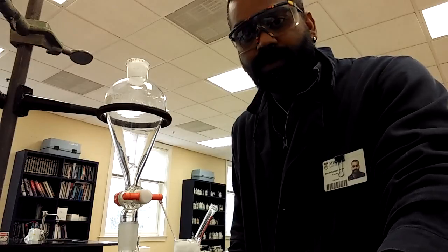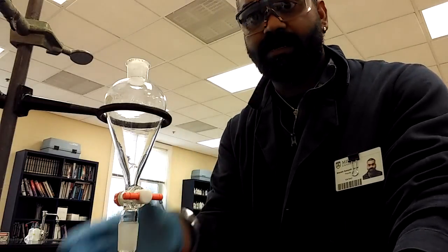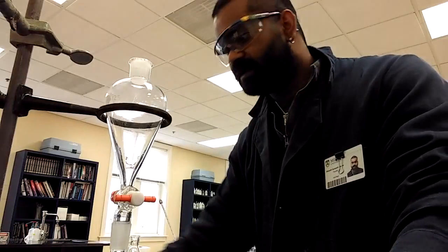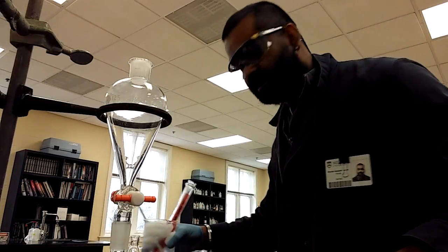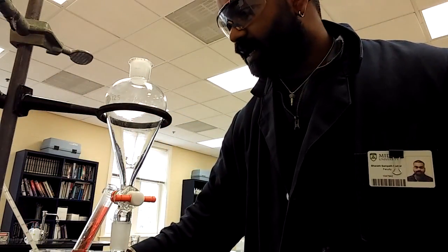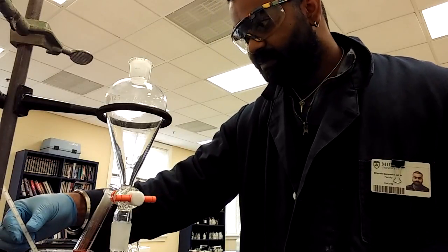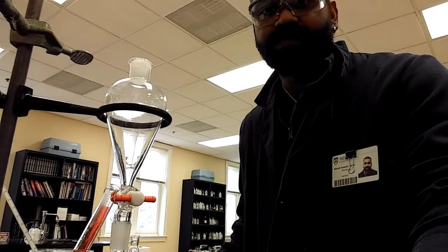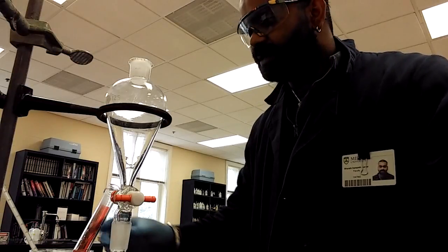All right, I'm back with the first step in the procedure, which is I got an O-ring attached to an iron stand, and then I put the separatory funnel here. I got my stopper with me. So here's my 35 milliliters of hydrochloric acid that's been sitting in the ice bath. Currently it's at actually bingo, 4 degrees, and the procedure calls for 5 degrees. So as I said, if you're plus or minus 1 degree or 2 degrees, it doesn't have to be that accurate.